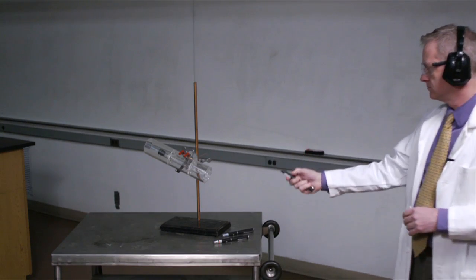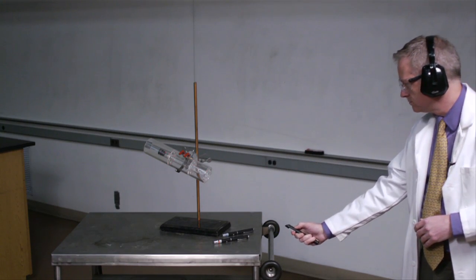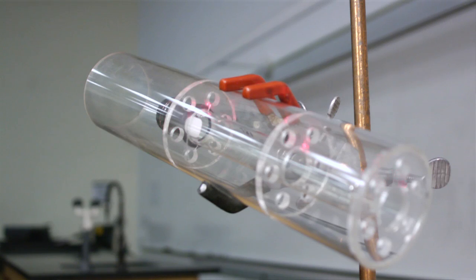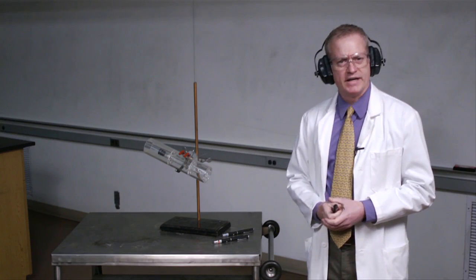shining into the gas mixture. Not much happening.